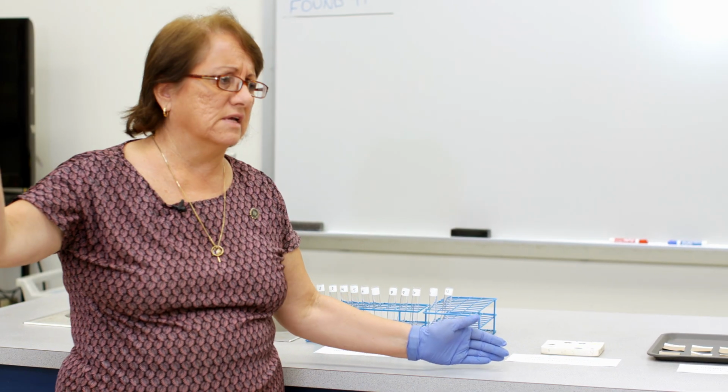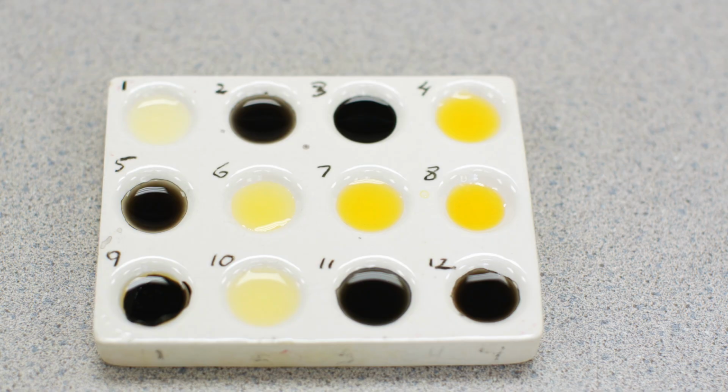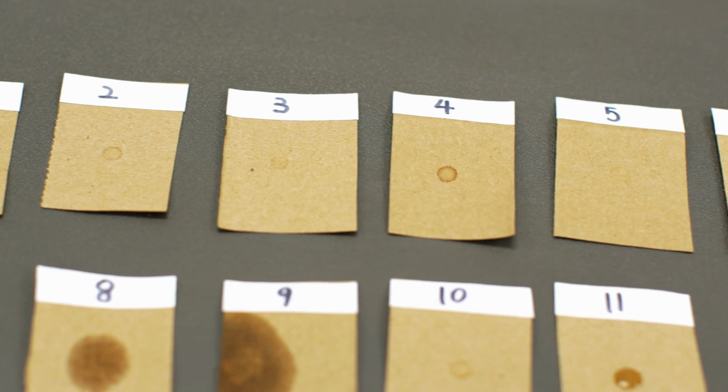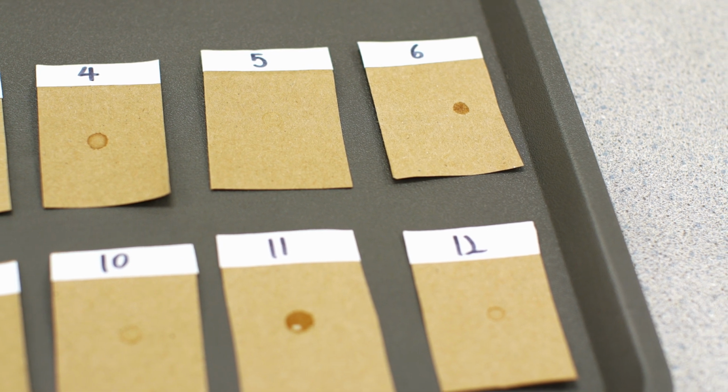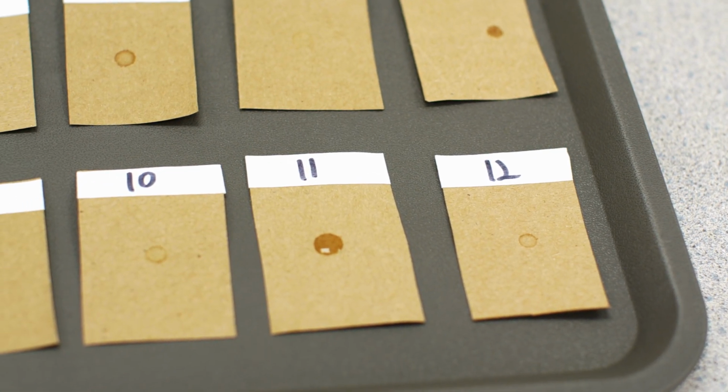Again, we said the Lugol's test is going to give you a black color. So you can tell from these unknowns which are black, and the ones that stay yellow or clear color, they're negative. Okay? There's the test for lipids on the brown paper bag, just as we talked about earlier. And if it's leaving a greasy spot, it has fat. If it doesn't have fat, it won't be greasy.